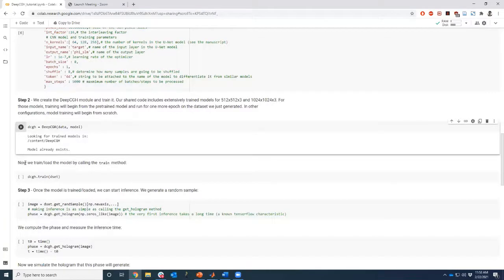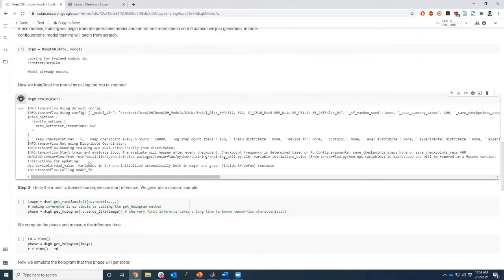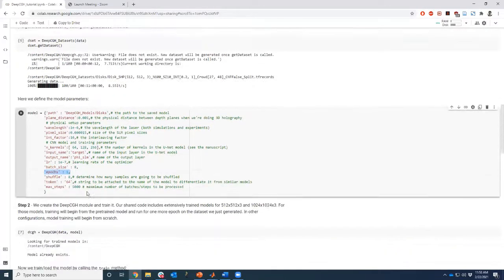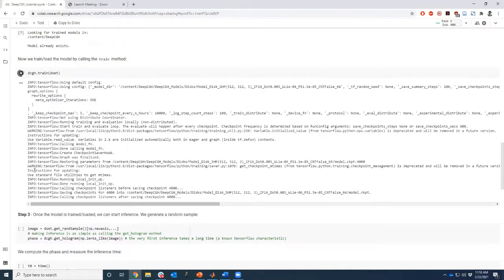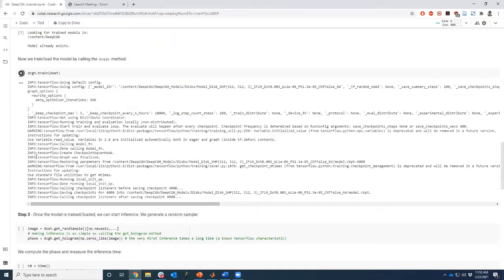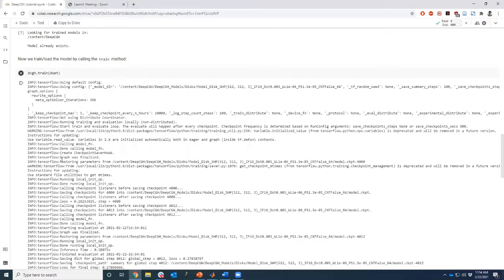And so here what we're doing, just for the purpose of displaying, is that we're going to add one more epoch of training to our algorithm. So this is just to demonstrate that things work. Here we're only going to do an additional epoch. So we start from the trained model that we have uploaded from GitHub, and we're just going to run the training step for the purpose of demonstrating that it works one more time. And this step should take about 10 seconds, if I recall. Time for a sip of coffee.